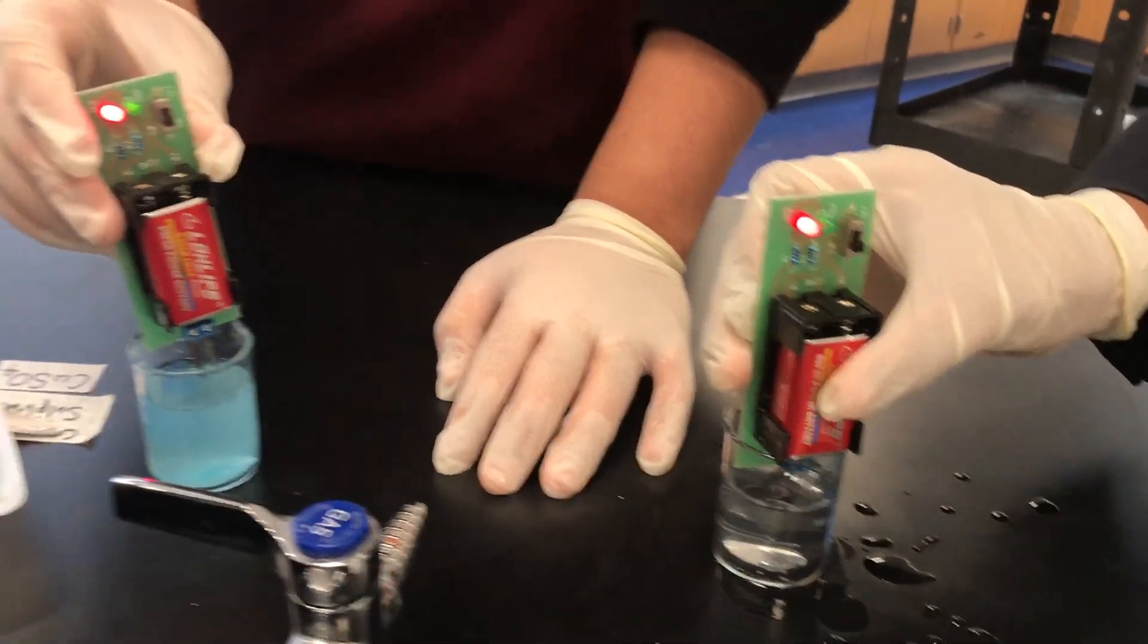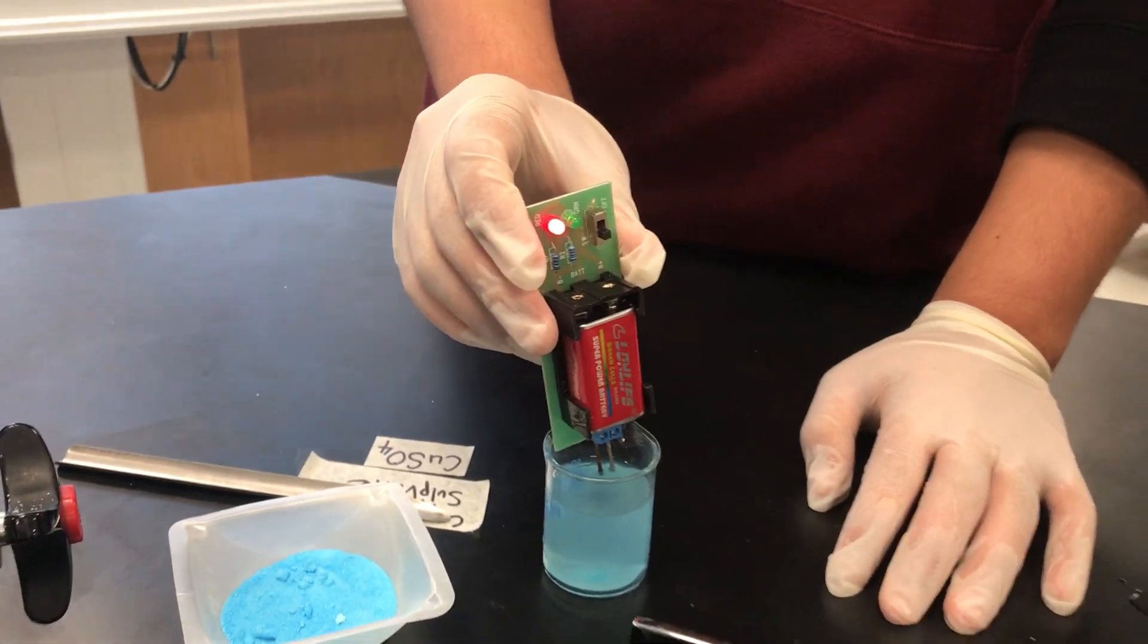This does the same. Let's see over here, we have the same reaction here. We do have the same reaction at the bulb light.